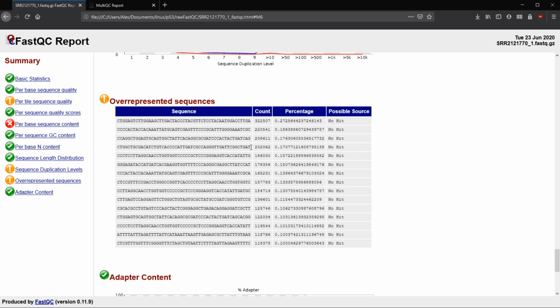And it's possible that it identifies a source, but because it identifies a source does not mean that this sequence would have come from this contamination source. So we don't have any hit, so it makes it a little bit harder to explain. But what FastQC will do is compare this sequence against a small subset of known sequences to see whether or not it can find a possible source for why this sequence is now overrepresented. But the most we had is 0.27%, and the least that shows up here that's considered overrepresented is 0.1%. So like above.